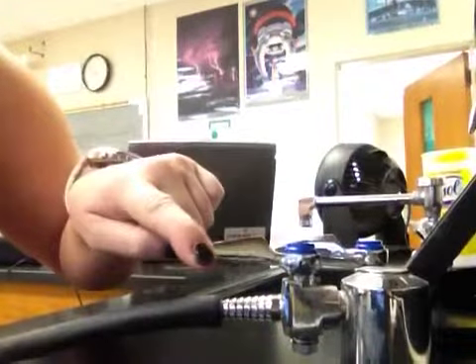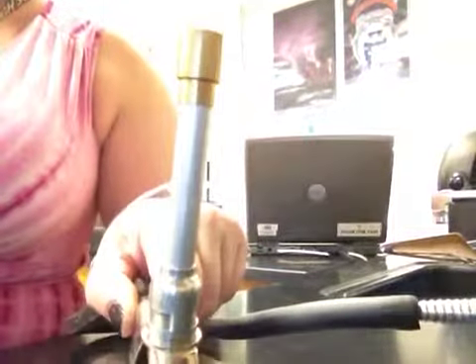The gas handle is perpendicular to the nozzle. And when I want to turn on the gas, I change this so that it's parallel, and you can hear the hissing of the gas. So once your gas is on, don't waste any time lighting your Bunsen burner.